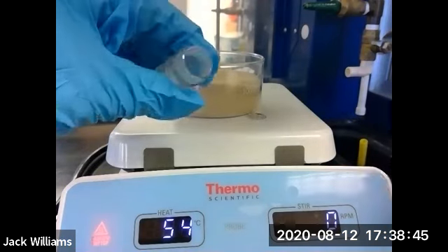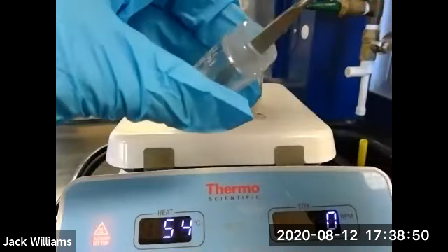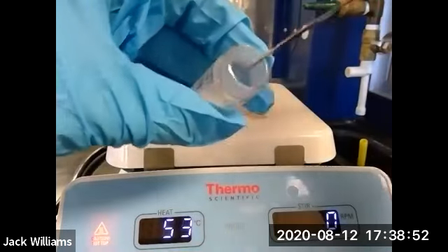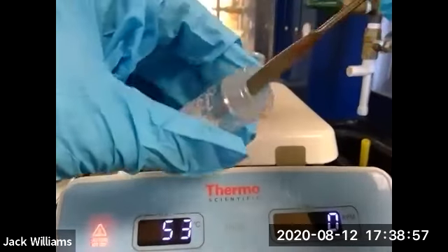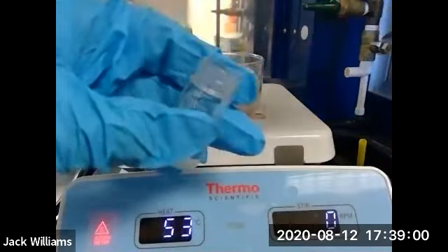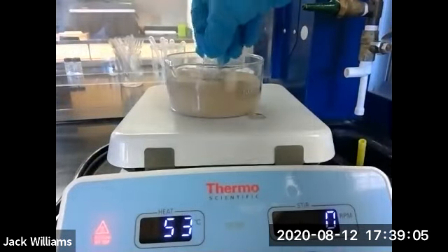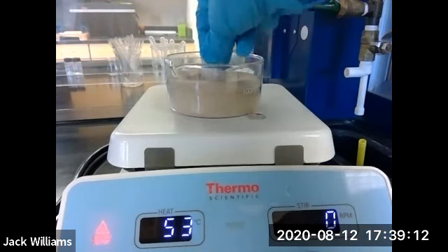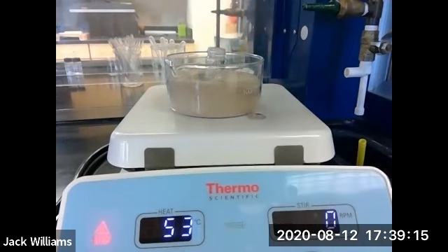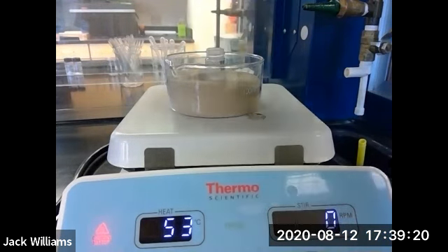Now, there may be a little bit of methylene dichloride still clinging to the benzoic acid. I know the experiment says, well, look, let's break up the clumps of benzoic acid and weigh it again. I doubt whether there's much in there, but you could do that, right? It's probably a good technique for you to learn. So you're going to break up the clumps. You're going to weigh it, and then you're going to bring it back, right? Put it in the sand bath, let it go for another couple of minutes, take it back and weigh it again. And it'll be consistent in terms of its weight, but do it so you get the idea of how you perform this particular technique.